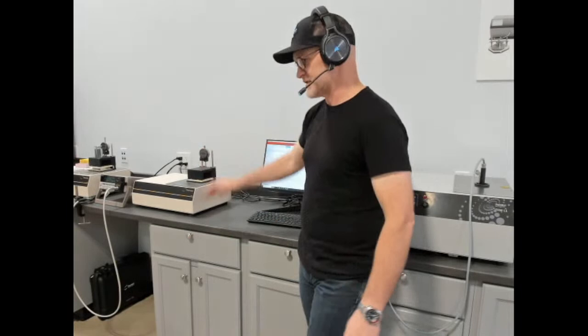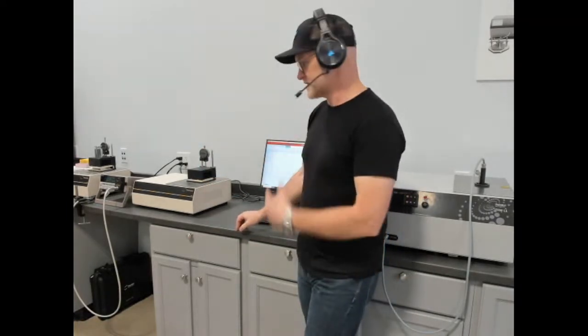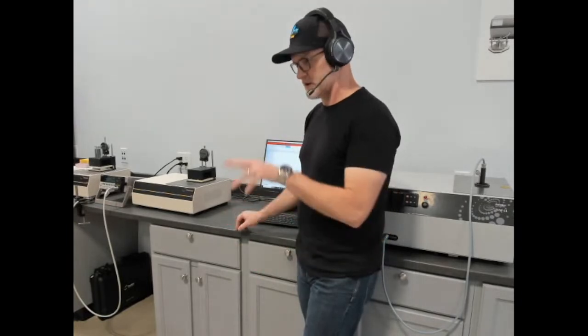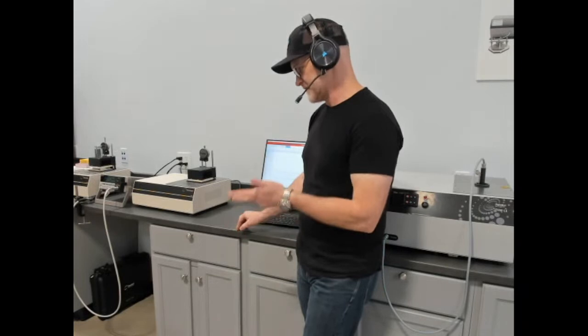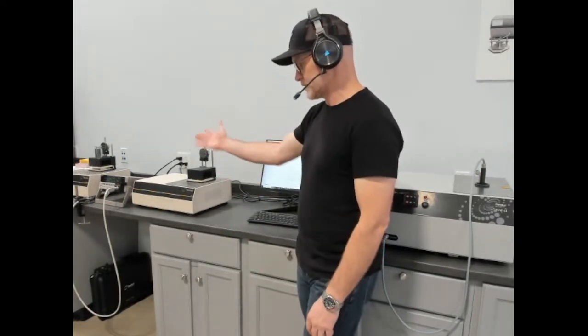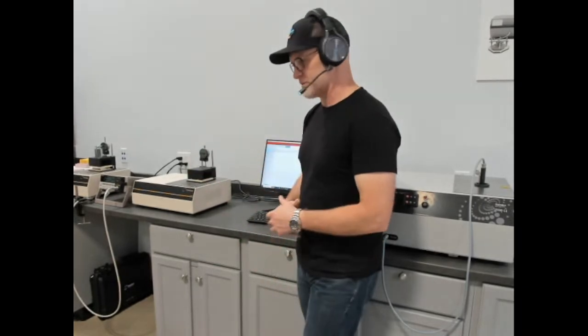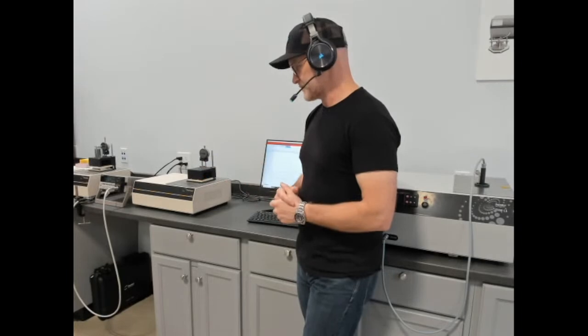Next to that is our TPS-3, which is our portable series of TPS for multi-property measurement following the transient plane source method: thermal conductivity, thermal diffusivity, and specific heat. One size sensor, easy to use. You can acquire it with a Keithley meter, or if you have your own Keithley meter, you only need the package for the sensor adapter and software.